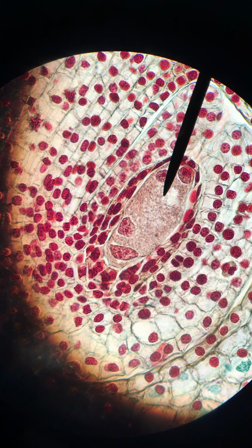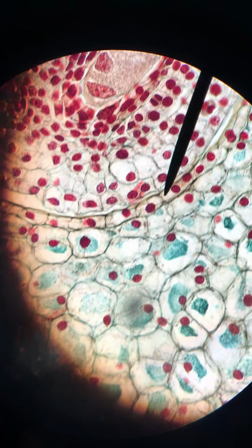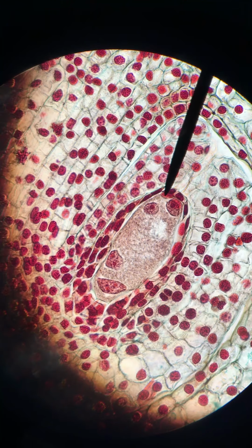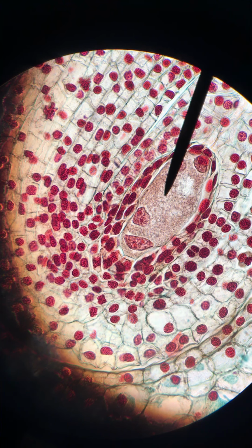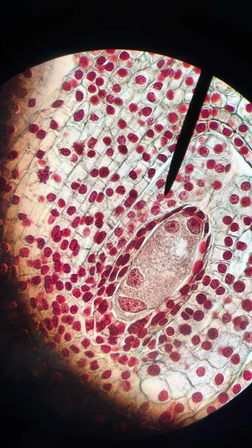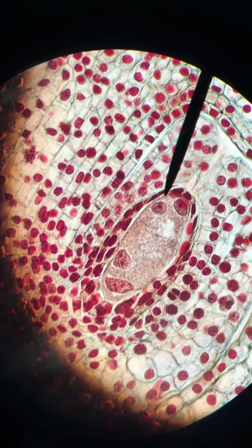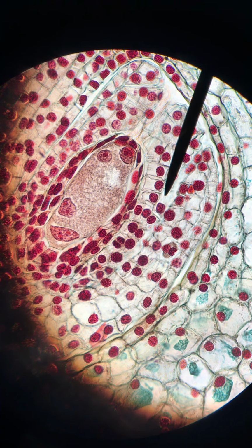So this will ultimately become an 8 nucleate mature female gametophyte, and we will look at that on our next slide. But right now we have the ovule, which is this entire structure here. And within that, we have our developing embryo sac here. It's currently at the 4 nucleate stage. The integuments, again, were the layers that surround the developing embryo sac. So right here, there are layers of cells on either side, here as well. These are the integuments. They will become the seed coat.